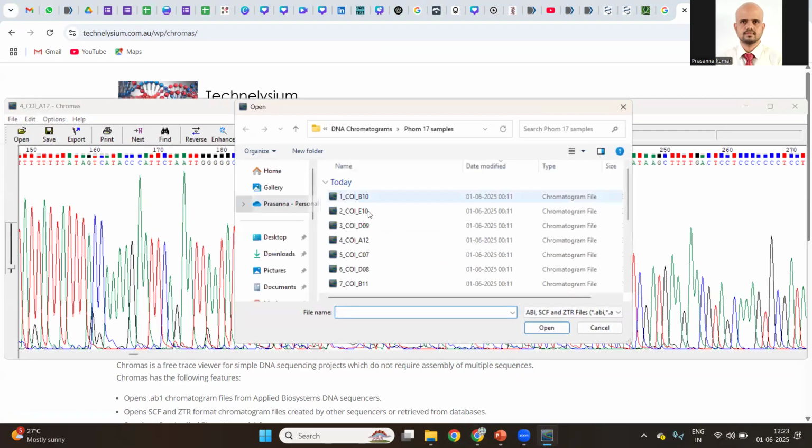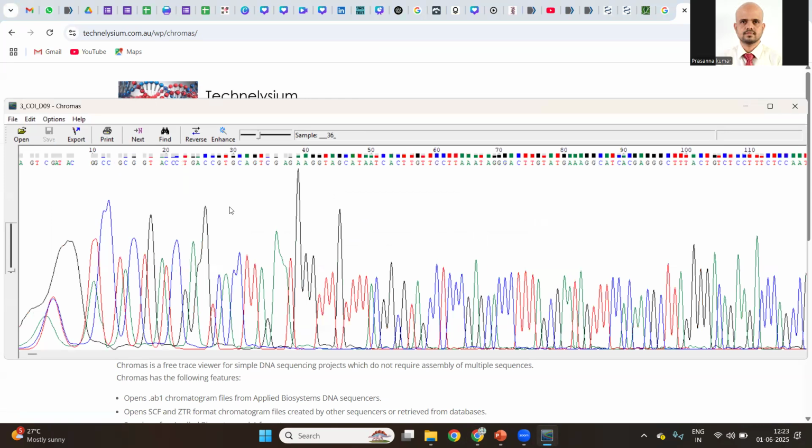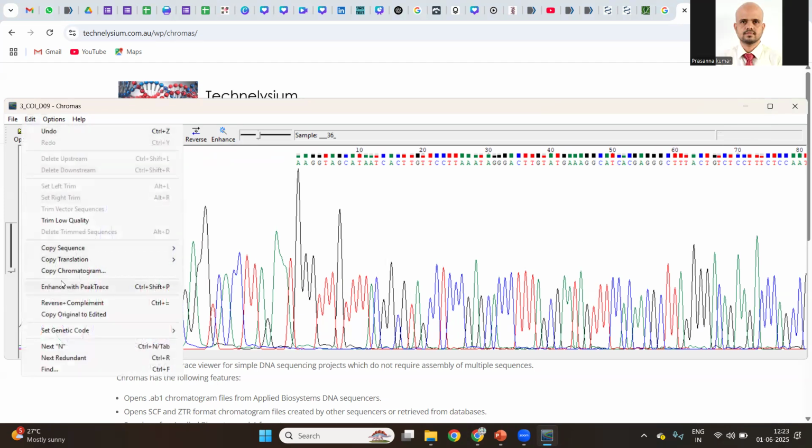I will send you three files. You are supposed to identify which file is the workable file, and the other two files have either degraded DNA sequences or mixed culture sequences. So ignore two files and select the file which has very clean sequences. Extract it. How to extract the DNA sequence? See here, maybe after the 40th base pair I will consider. The remaining part I don't want to work with, even though if you spend some time you can work on it. So I'm just deleting this. That's it. From the 40th base pair, I have a 10th base pair here, 20th here. When this is done, go to edit, copy sequences, plain text.